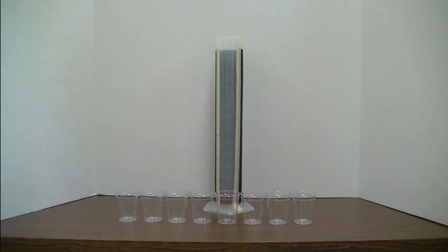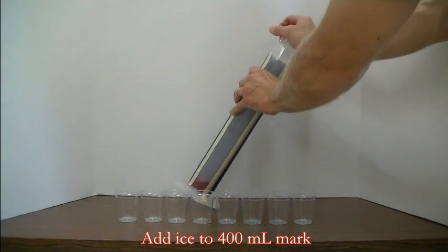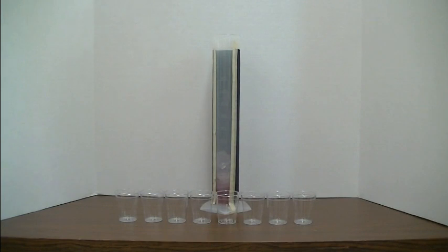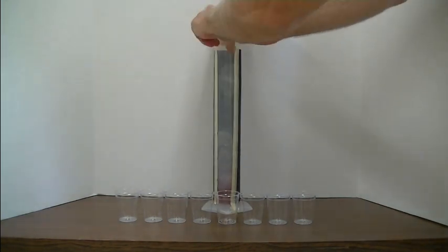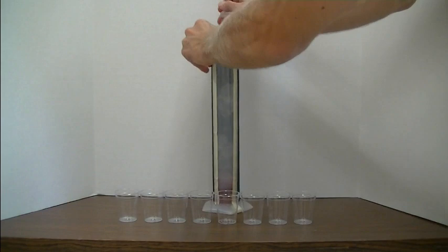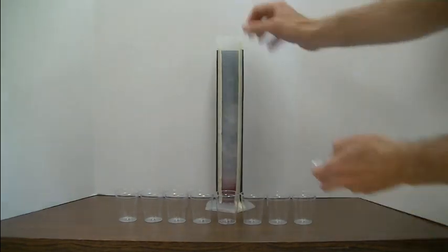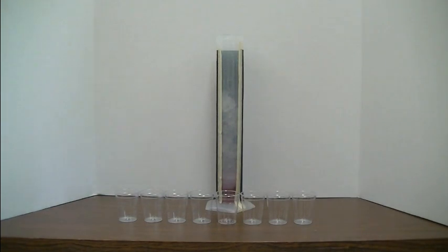Now I'm going to fill this with ice up to 400 ml. So I'm just going to put a bunch of ice in here. What we think the ice does is keeps the layers from mixing too much. That's about right. That should be filled to about 400 ml.